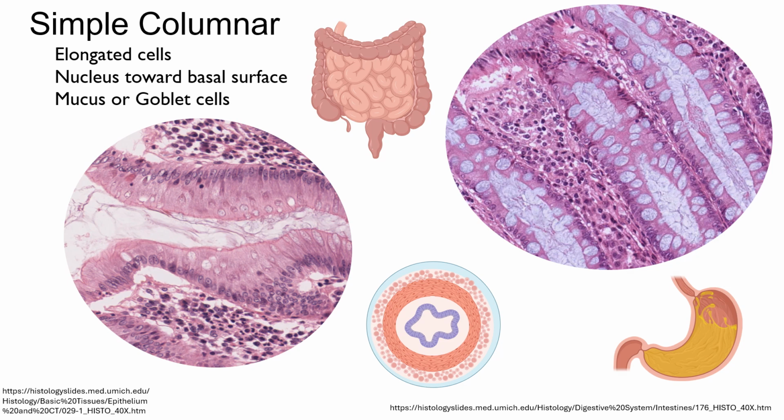These pictures here are from the digestive system, which is lined mostly with simple columnar from stomach to rectum. And you can see all of these cells lined up here, and I'm highlighting a line of their nuclei down at the basal surface. And so that means when I'm highlighting in green here, this area here would all be the lumen. The apical surface of these cells is against the lumen, and the basal surfaces are below it.